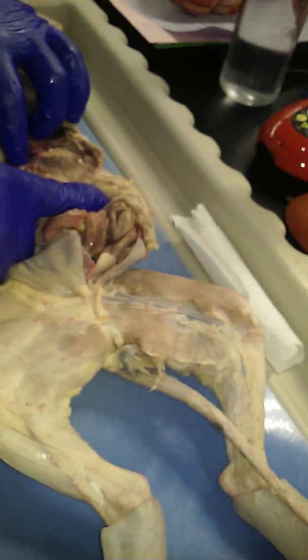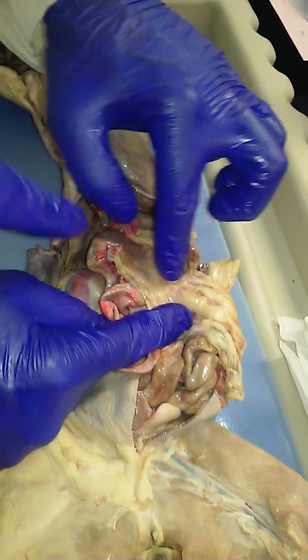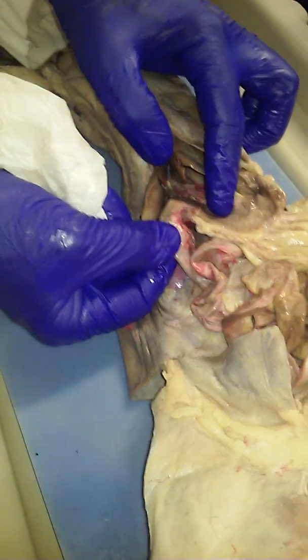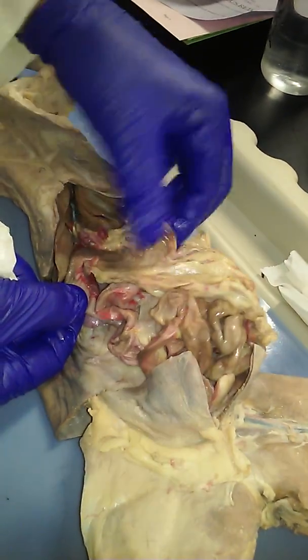Okay? Good? I wasn't able to get a clear picture of the pyloric sphincter. Do you mind pointing it out one more time? Because we couldn't even find it on our cat. Sure you can. You see a white line right there? Here's the stomach. And see, here's where it goes into the tube, into the small intestine. Here's the stomach.